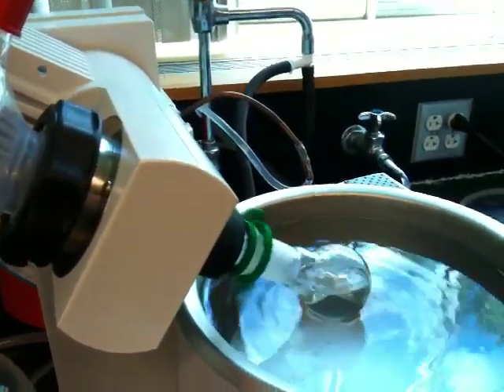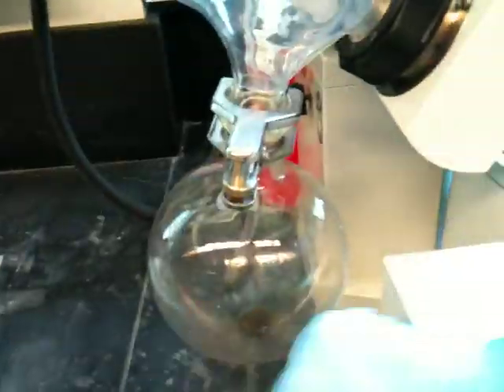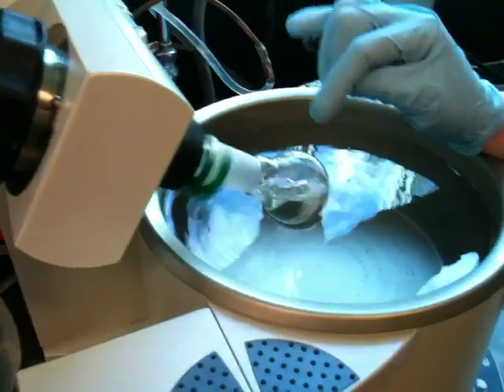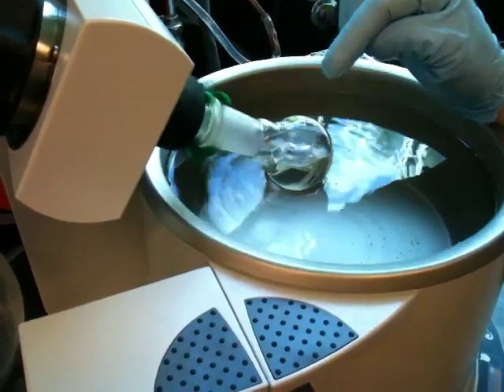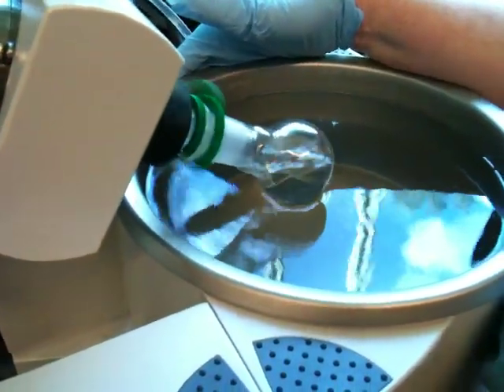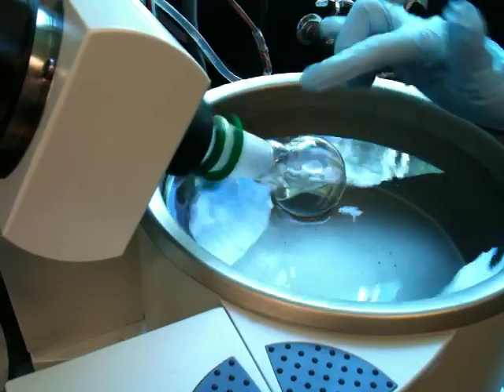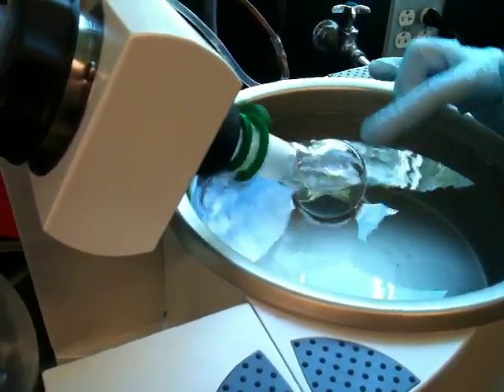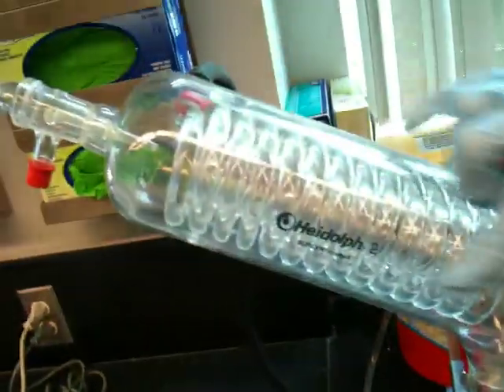So what's happening right now? This is the pot, this is the condenser, this is the receiver. The whole apparatus is at 20 torr — this means there's less atmosphere weighing down on that sample, so the molecules can lift off much more readily and at a much lower temperature. We only need to heat it to 40 or 50 degrees. What's going to happen in a matter of five minutes is that all the solvent in here will evaporate because it doesn't have a lot of atmosphere weighing down on it, condense on these coils, and drop into this receiver. Very fast process — it takes five minutes.